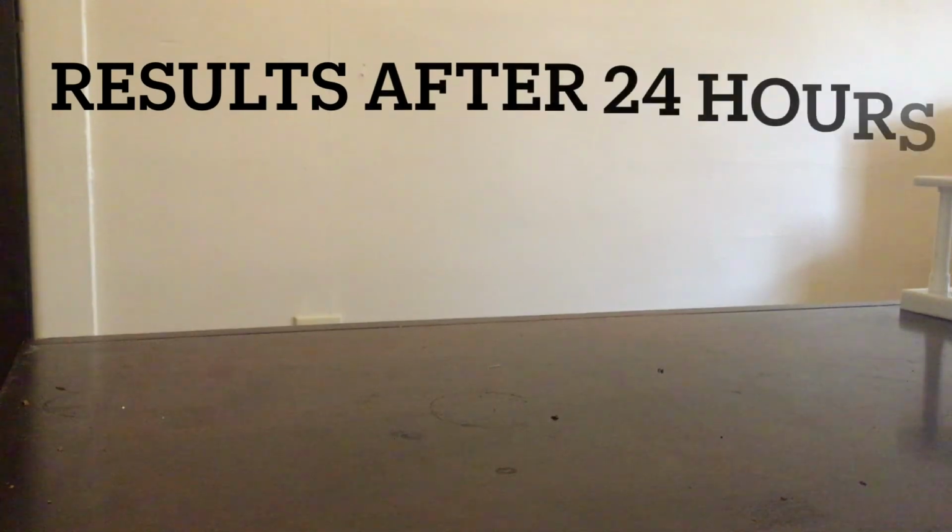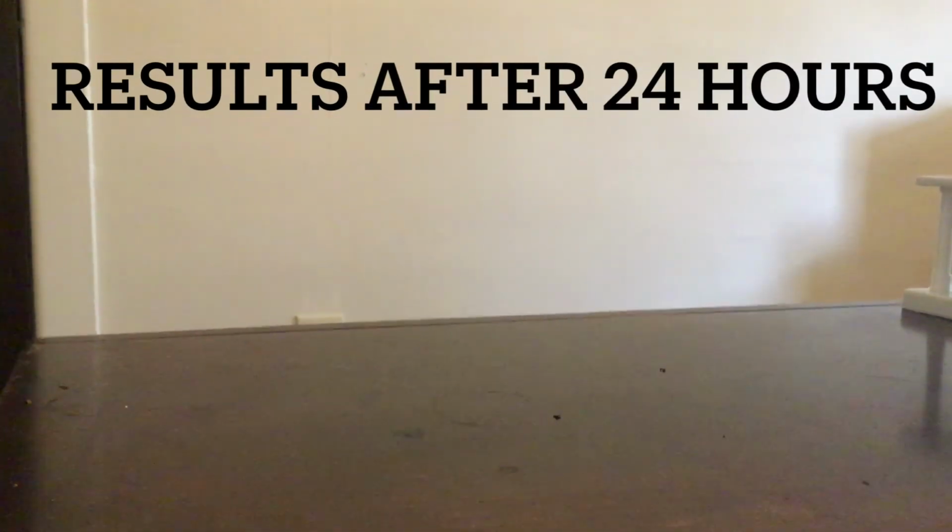Hey guys, this is Mr. B, and I am here today to go over with you guys the results from the aquatic plant lab after the 24-hour period in which it ran.